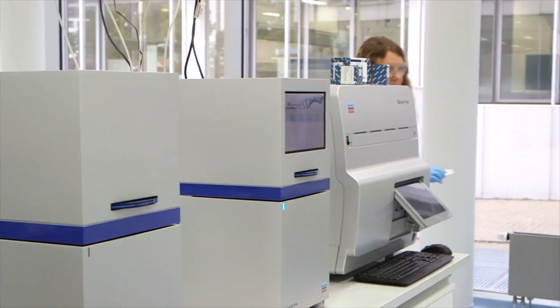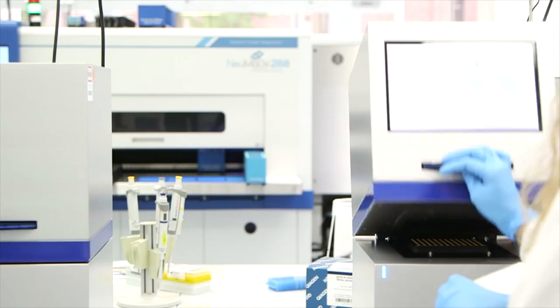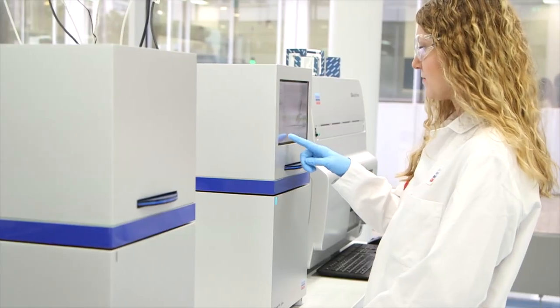Seal the plate, place it in any real-time cycler and start the cycling program. Finally, interpret results once the run is finished after one hour.